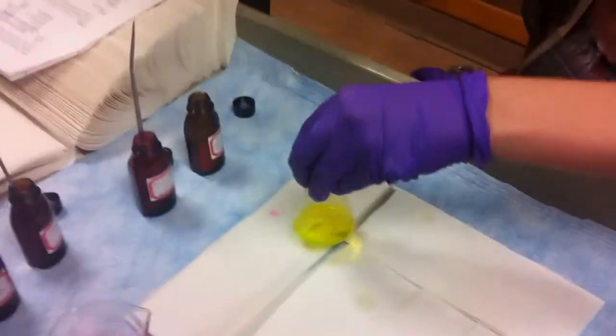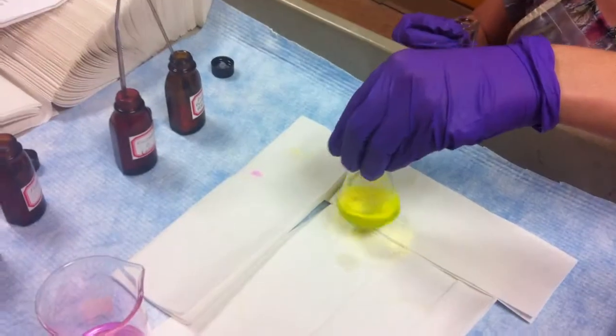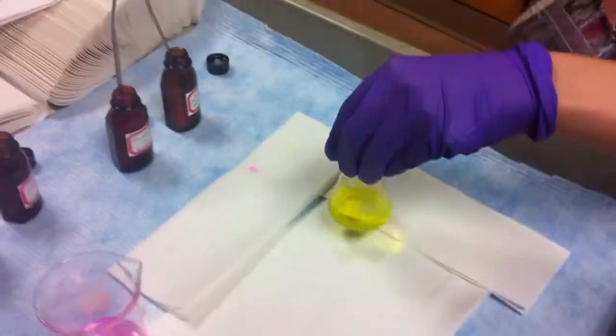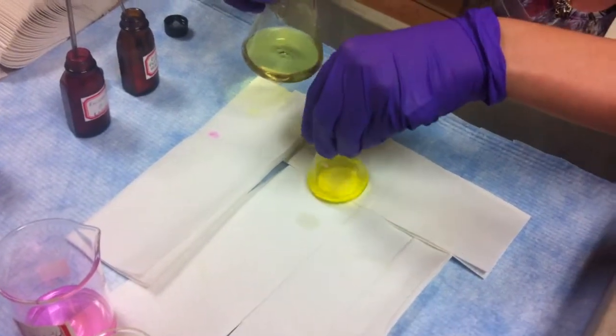Can you please? It's pea colored you said? It's pea colored. Can you take all points for me calling it pea colored? Well, at least I know what that color is. When people call it pea colored, there's no color. You ready? Yep.